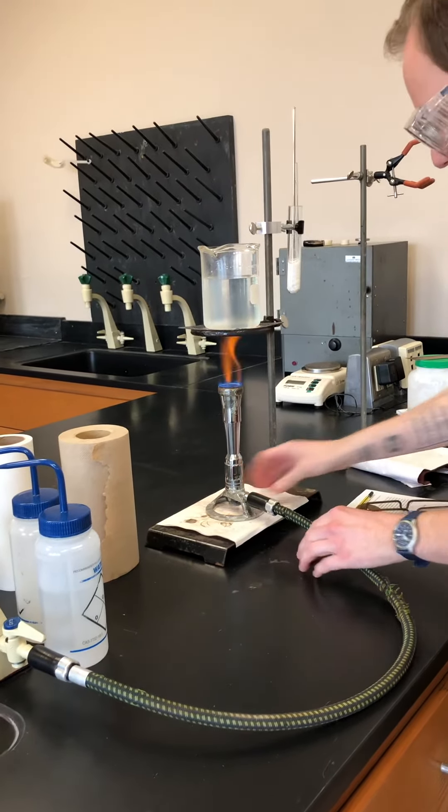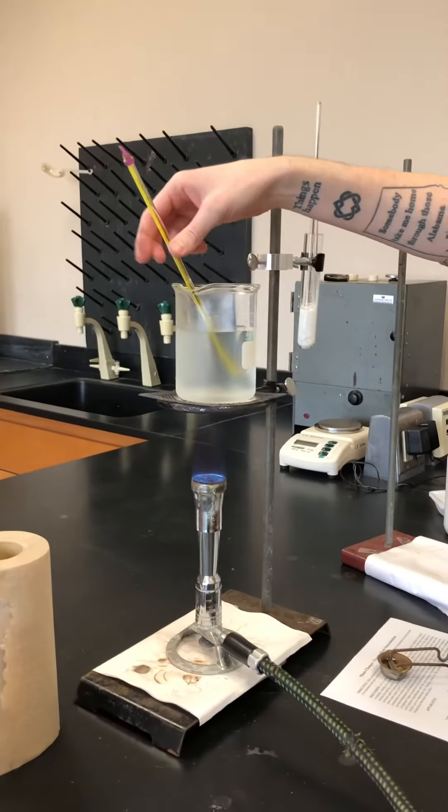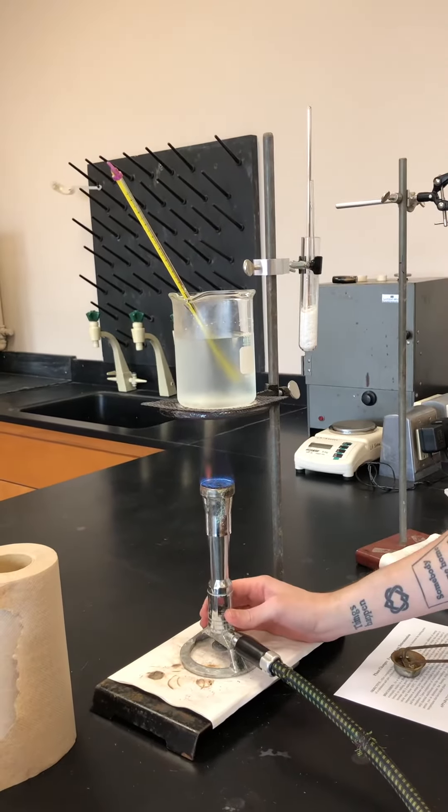And so I'm going to put my thermometer in here so you can start measuring that temperature. Right now it's just at room temperature, but it'll slowly heat up.